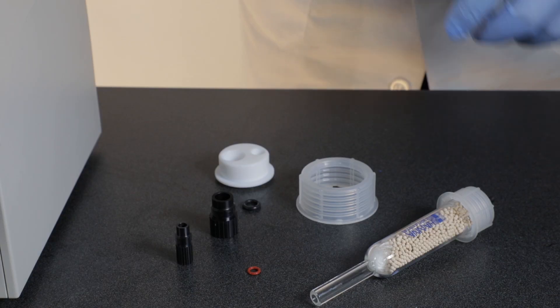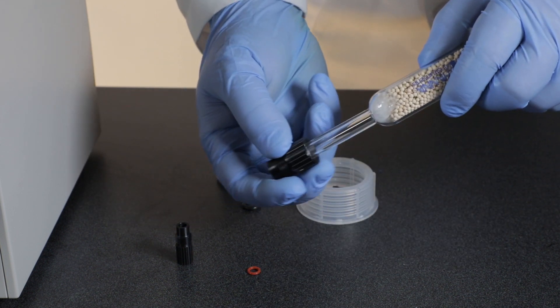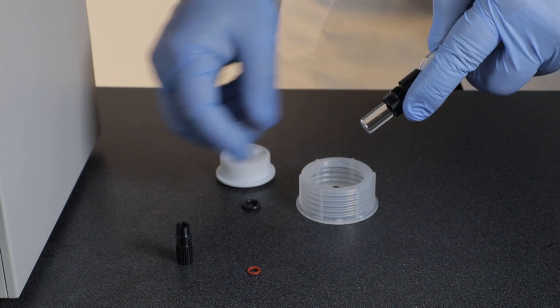To build this assembly, remove the 10mm and 5mm fittings and O-rings from the bottle top. Start with a desiccant cartridge. Insert it through the 10mm fitting and O-ring and tighten it onto the bottle top.